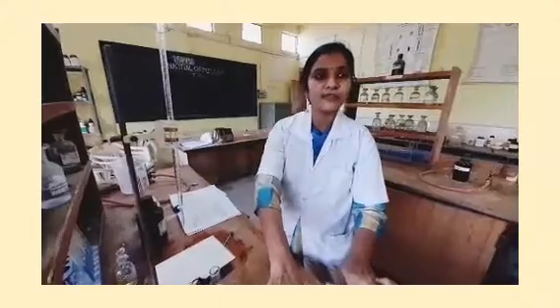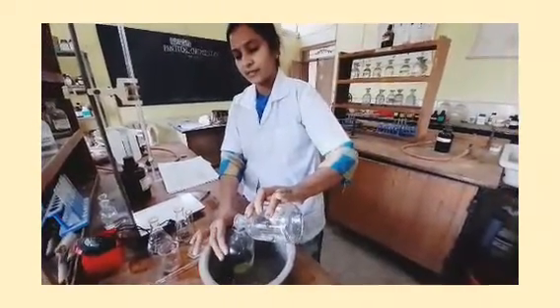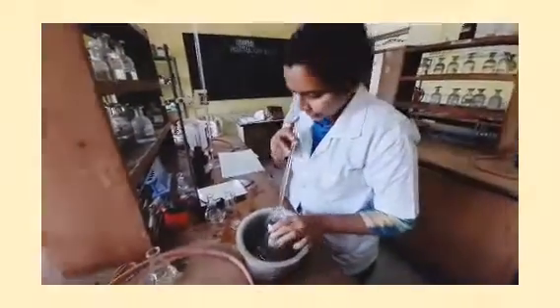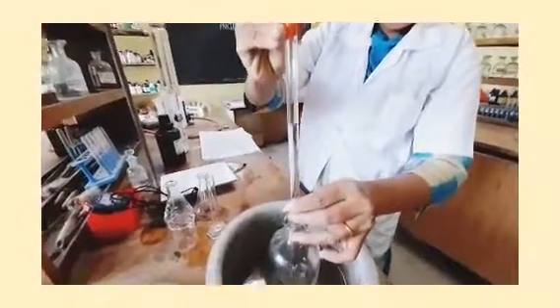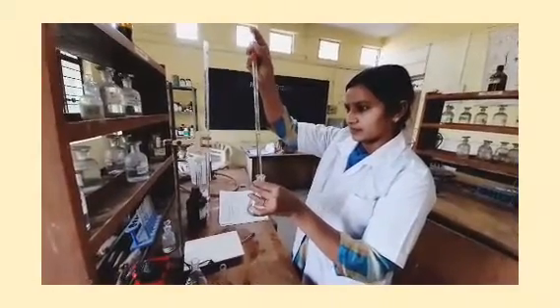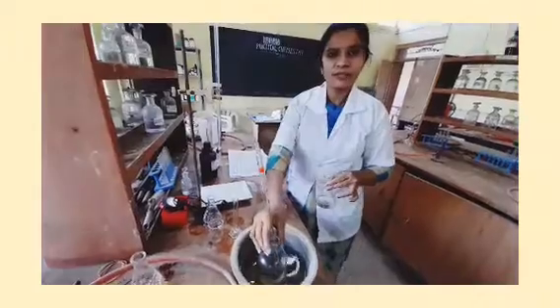Now, when both liquids have attained room temperature, I just add 100 ml of 0.5 normal HCl into the other bottle containing 5 ml of methyl acetate. After addition, I immediately take out 5 ml of the reaction mixture by pipette. Please do this carefully. I add the 5 ml reaction mixture into the conical flask already containing cold water and phenolphthalein indicator. The remaining mixture I insert back into the bottle containing the reaction mixture.